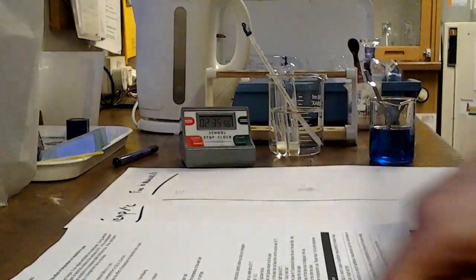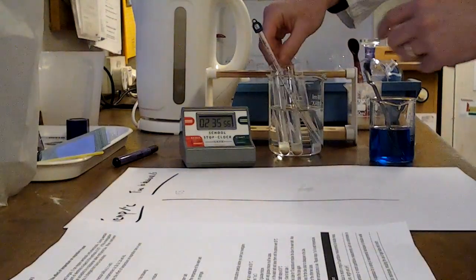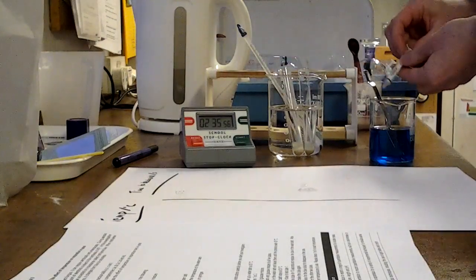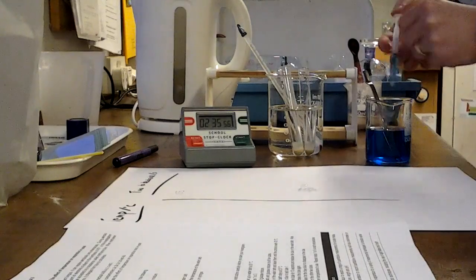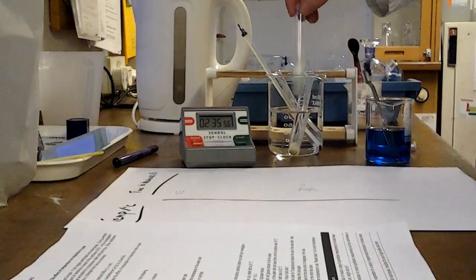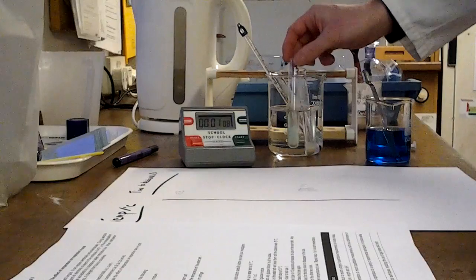Okay, so I've recorded my first result. Now I've also got tubes 2 and 3. Now they are still at the required temperature. So what I can do with them is I can now set up another repeat. So 2 centimetres cubed, methylene blue. In it goes. Of course I'm keeping my eye on the water bath, making sure that the temperature is okay. So this one I'm now ready to start, and that'll be my repeat.